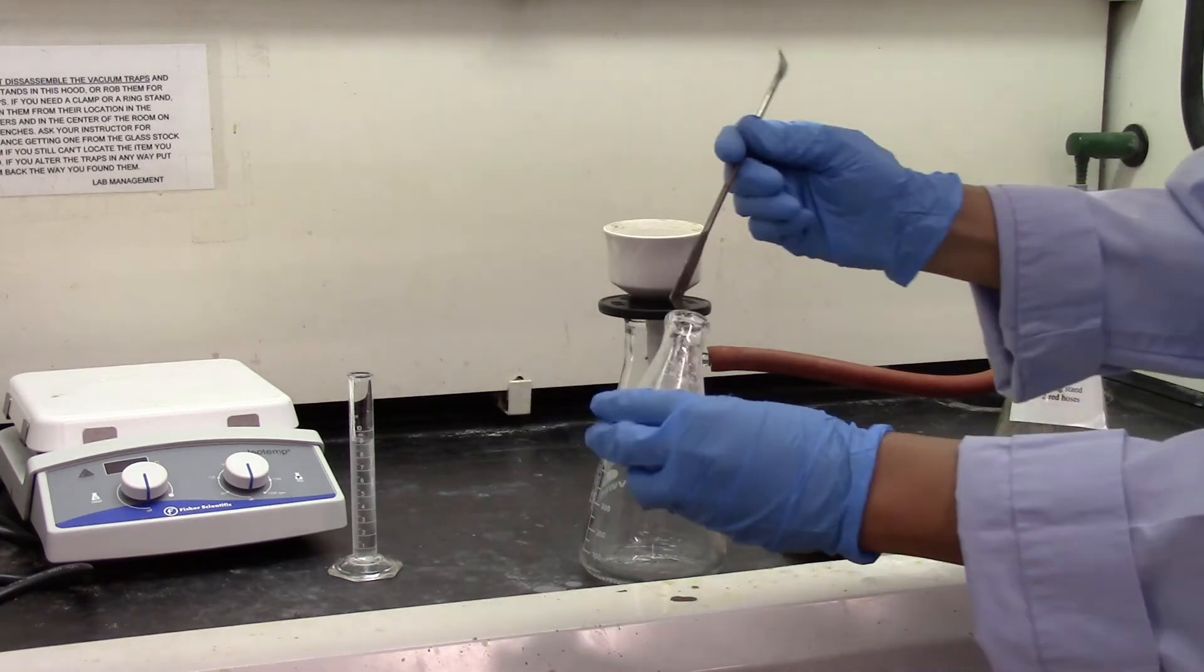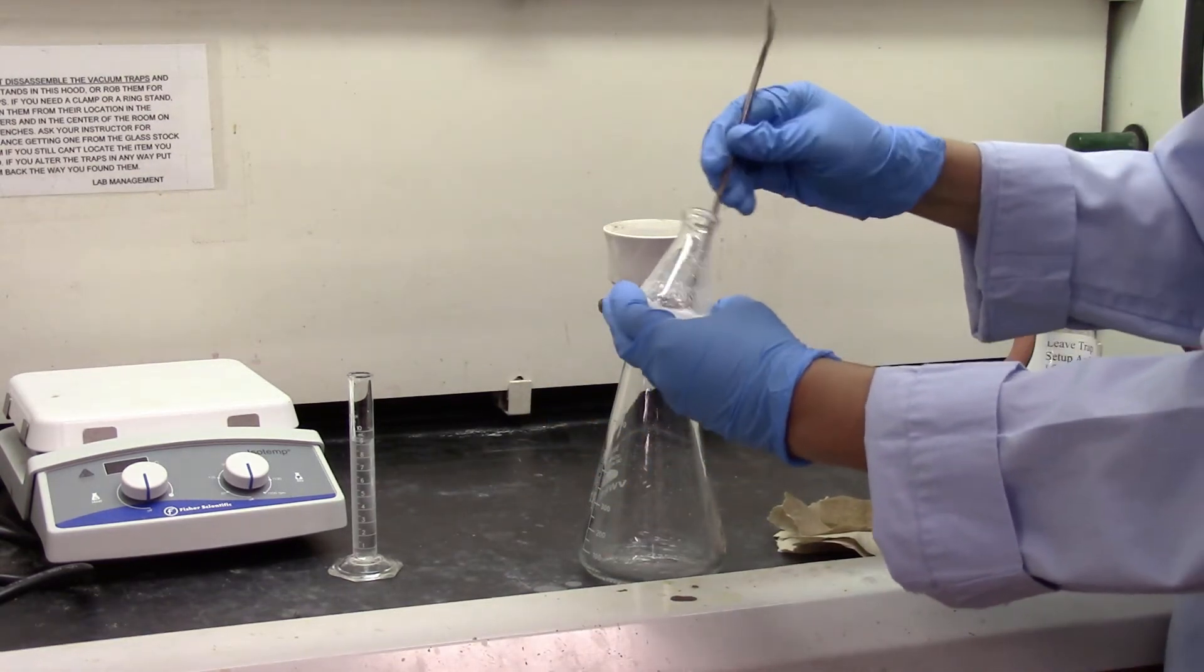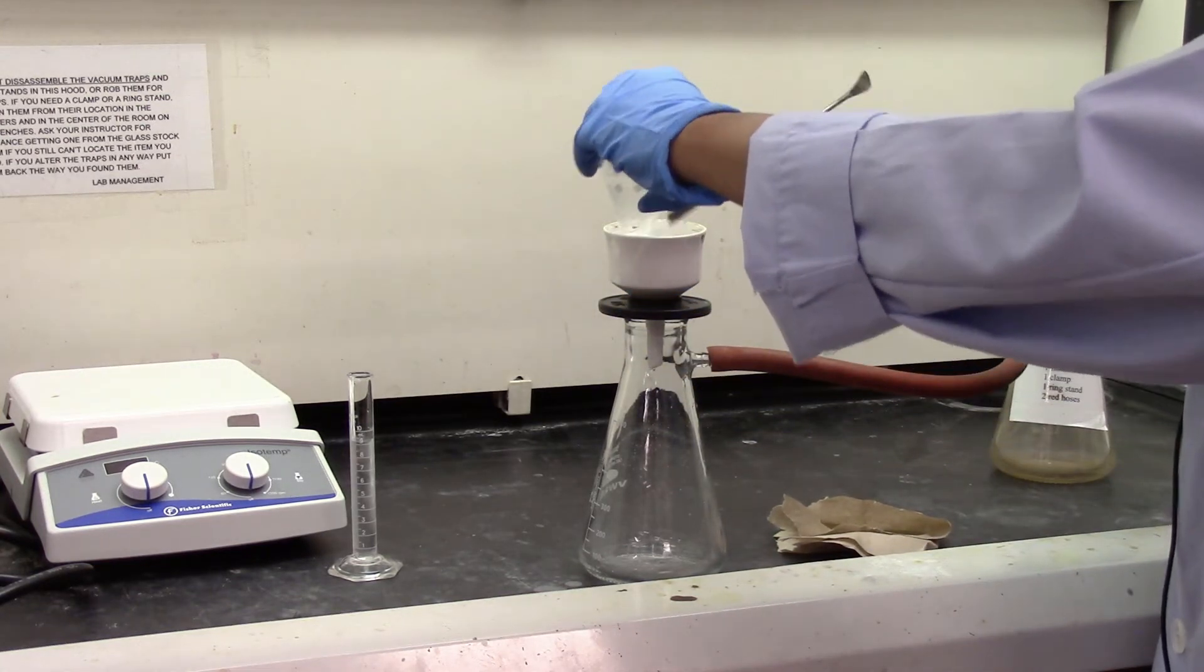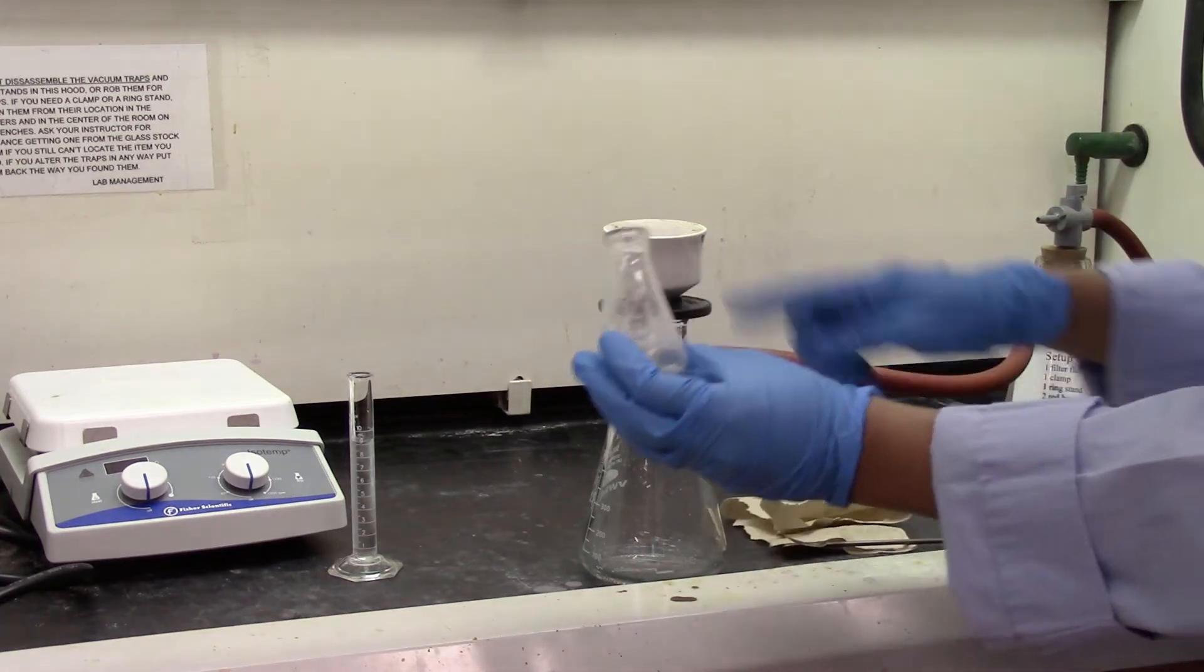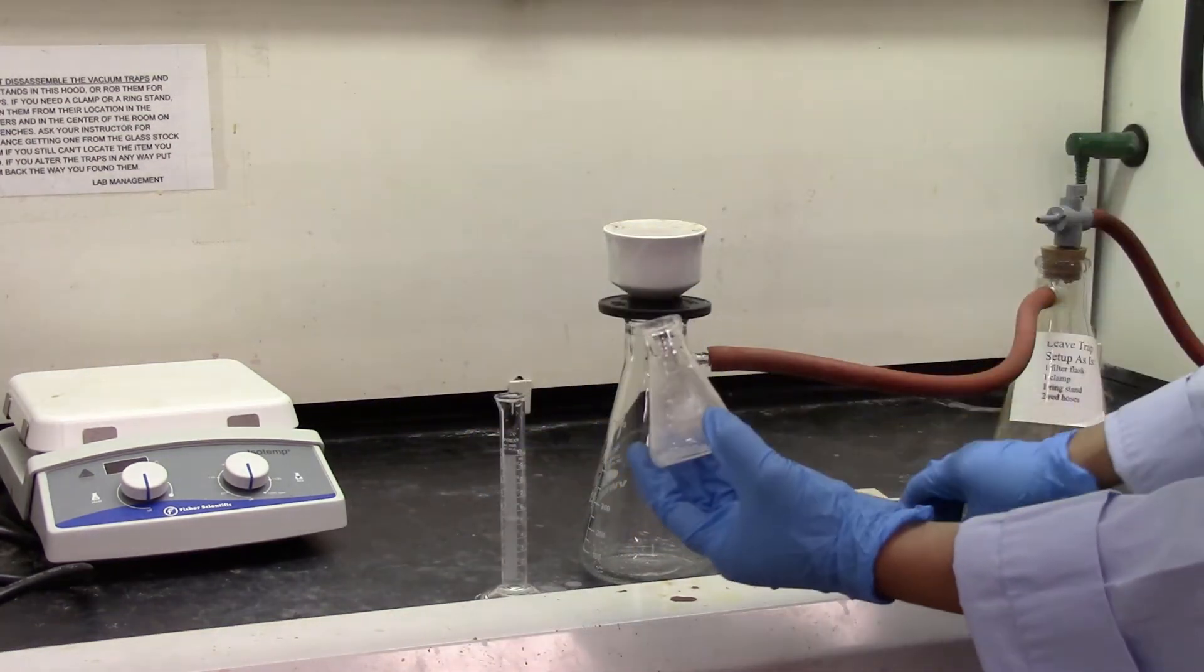I have turned on the vacuum. I'm going to go ahead and scrape the bottom of my flask to get all my product and then filter it out. And to get the rest of the product I'm going to add some more cold DI water.